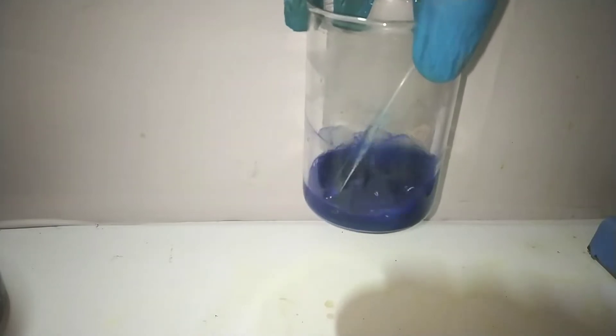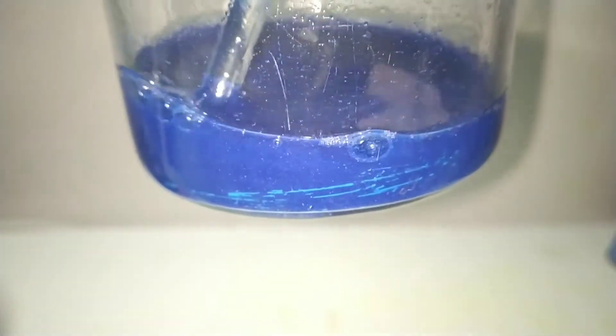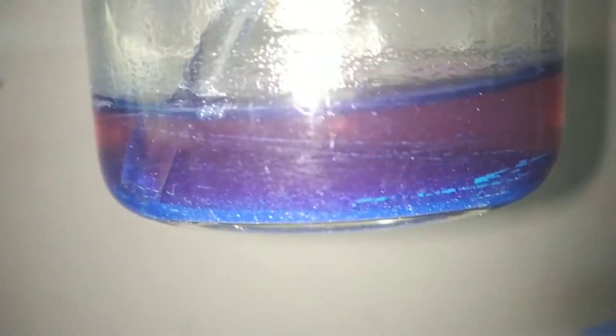The solubility of this compound is very low. Allow the beaker to stand for about 30 minutes to ensure complete precipitation. Here you can see the closer look. You can clearly see the minute crystals in it. On keeping the beaker undisturbed for few minutes the crystals settled down to the bottom of the beaker.